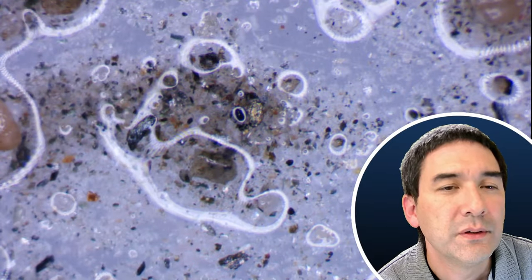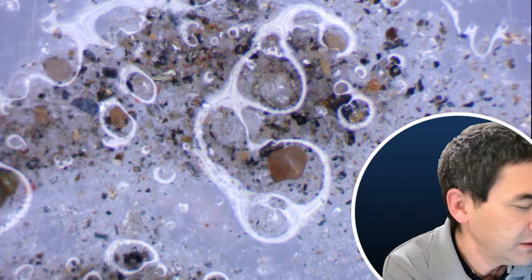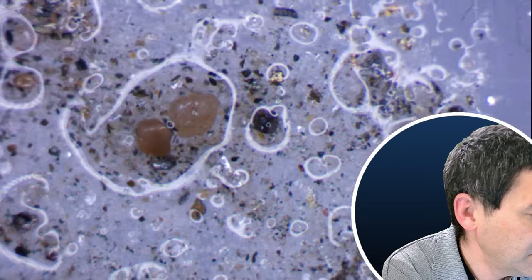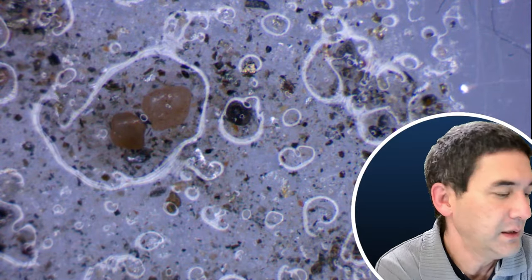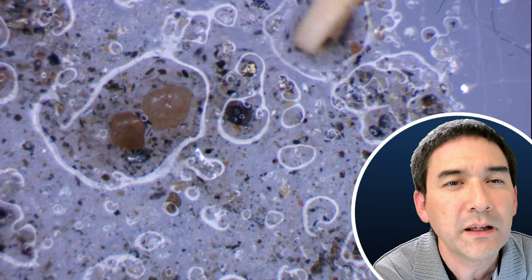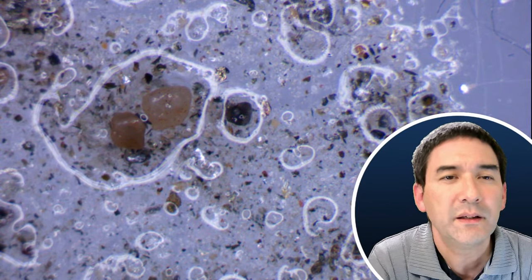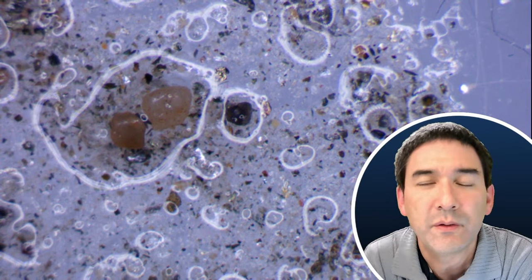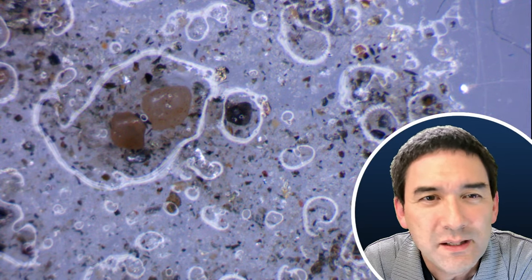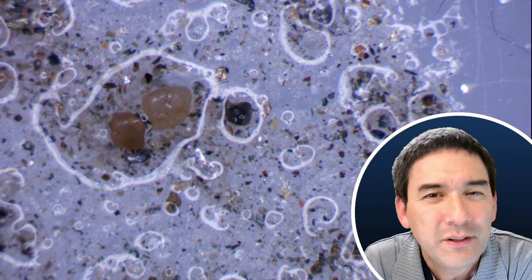Let's spread this apart a little more. Look at this one on top — it looks a little bit like gold, right? When I first saw this I was so happy — I thought there's really gold in there. But then I got suspicious because I found so many of them that I thought there really couldn't be that much gold in the sand. I did a little research and found out it's not gold. The reason is because it doesn't have the shape of gold — gold is not as flat but much more round.